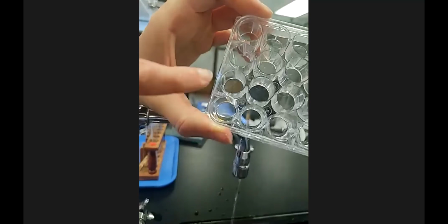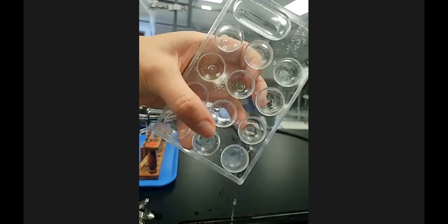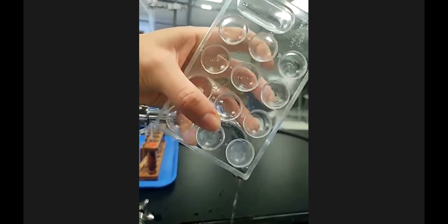Now, if there's a residue, this one has a slight residue. Another way is to take a piece of paper towel, use a little elbow grease here, and just put the paper towel in there and twist to get any residue. There's no residue really on this one, because you don't want it to look like this one, which has some caked on stuff. Someone didn't clean it well from whatever insoluble thing was on that.